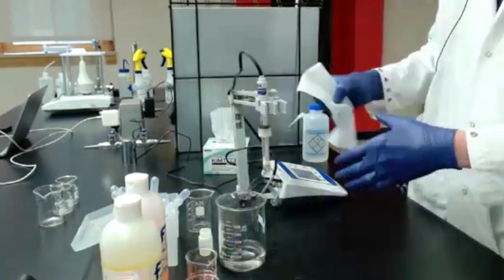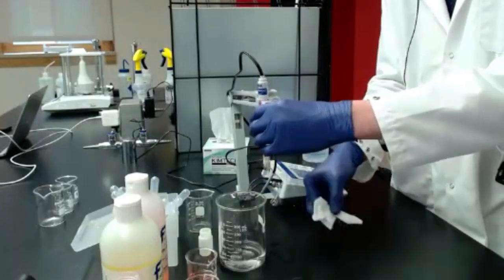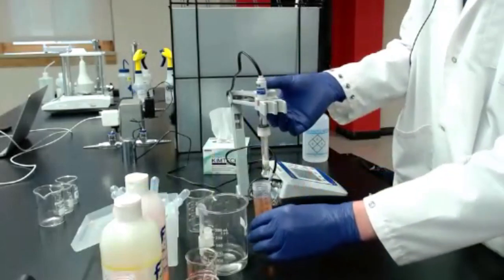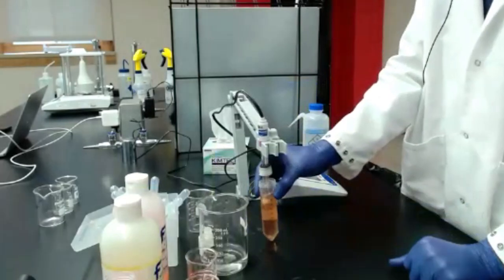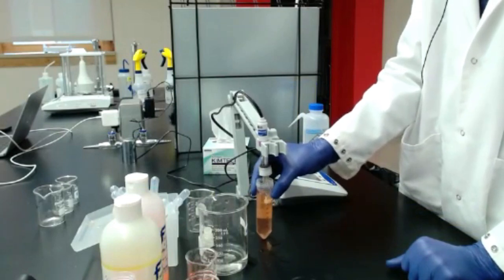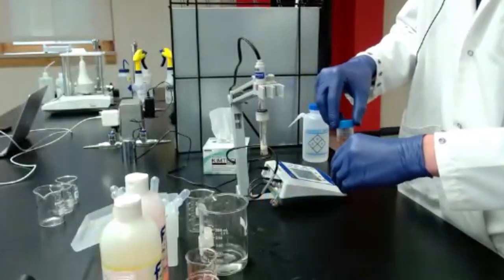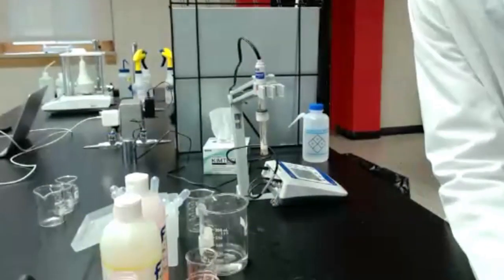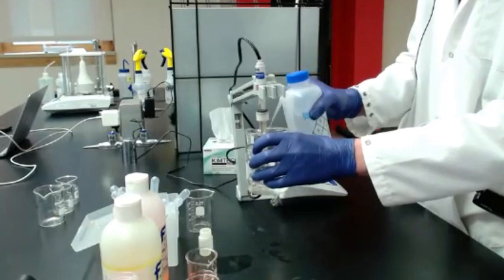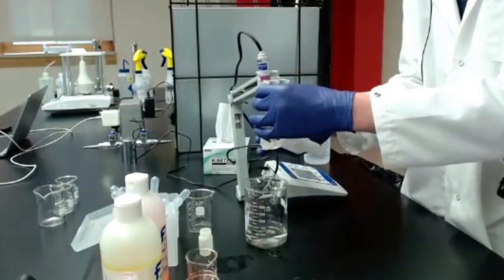Okay, so I got a little bit different value the second time. I'll share exactly what those are once we share values, but I'm actually going to do it one more time. I have another tube of juice, which came from the same pouch, but is stored slightly differently. So I'm going to go ahead and measure that one and see what we get. And really, these measurements only take a few seconds mostly. I'm taking a little bit longer because I'm trying to watch the screen, but if your pH meter is in good working shape and calibrated correctly, they're almost instant read. So they don't take too long to adjust and stabilize.